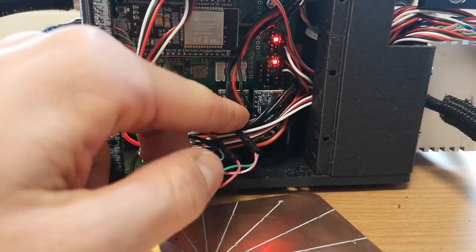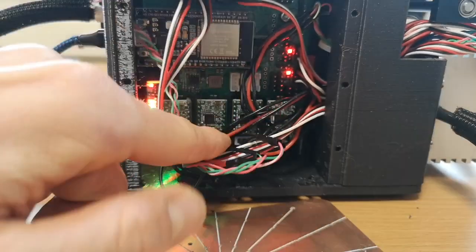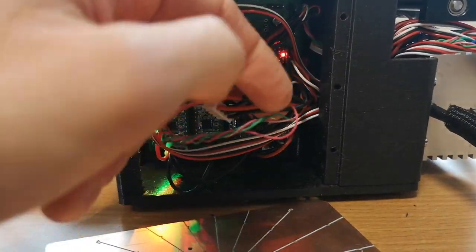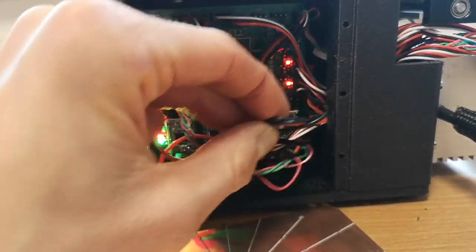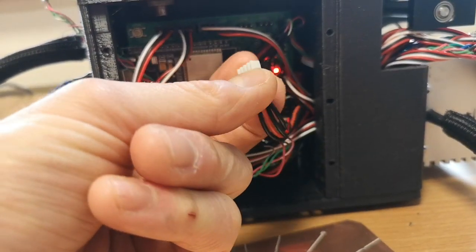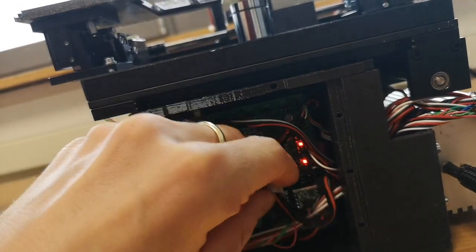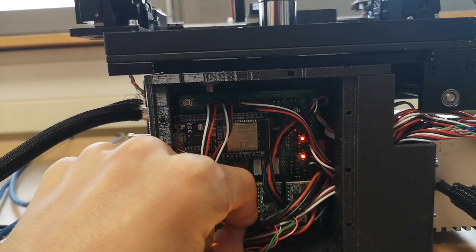So first make sure that you unplug the power, and then you can unplug this here and then move it to a different location. So this is, for example, if this is Y, you can just unplug it and swap it to the Y, X. And then if the direction of the motor is wrong, you simply need to rotate it and then plug it back in so that you can change the direction of the motor.